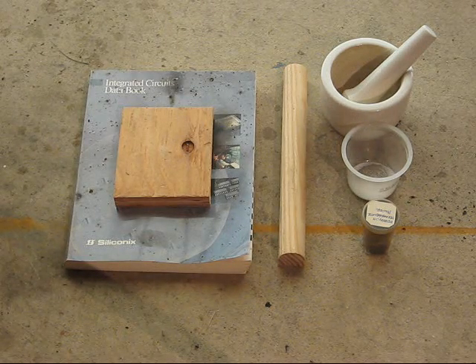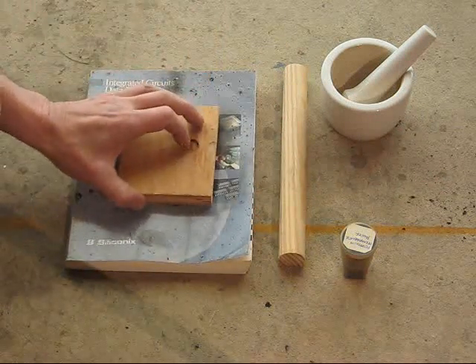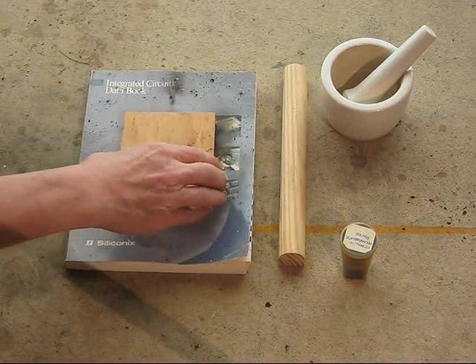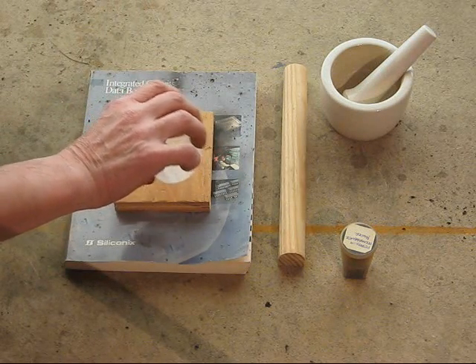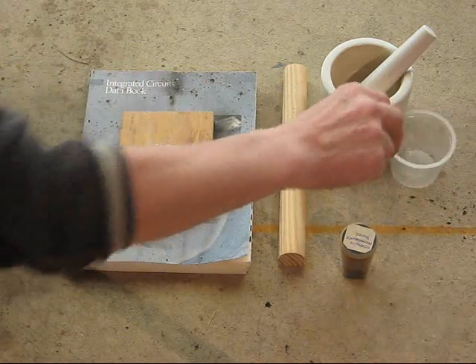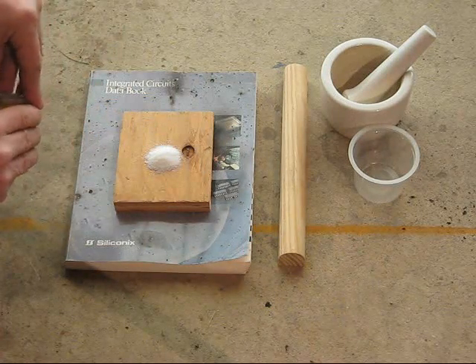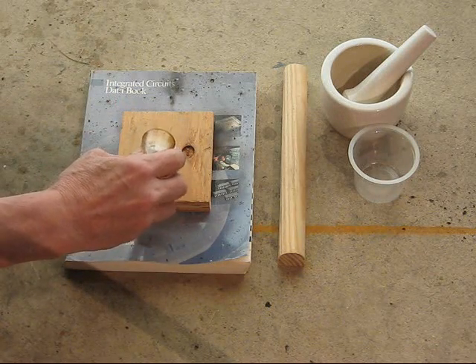Base shield down — it's just a piece of plywood on an old book. I'm just going to pile some sugar here; this is just regular granulated table sugar. Shield on and down, and some powdered potassium permanganate to be poured on top of that.